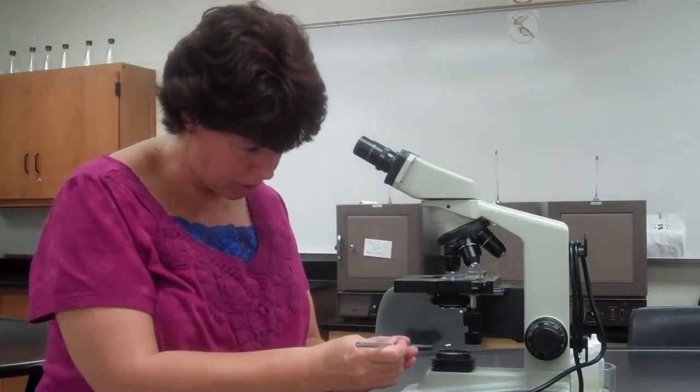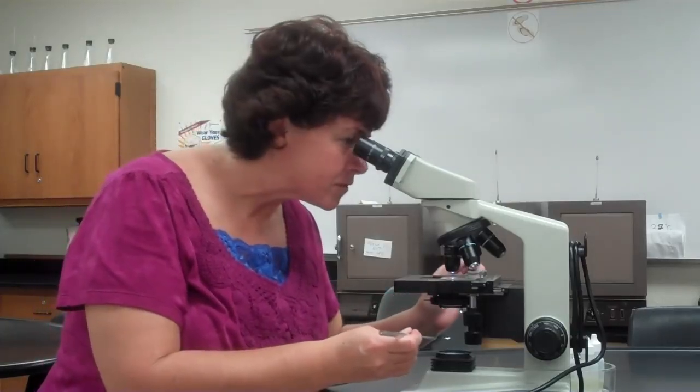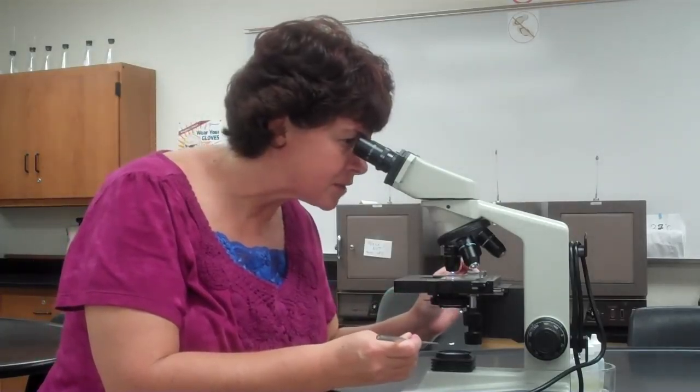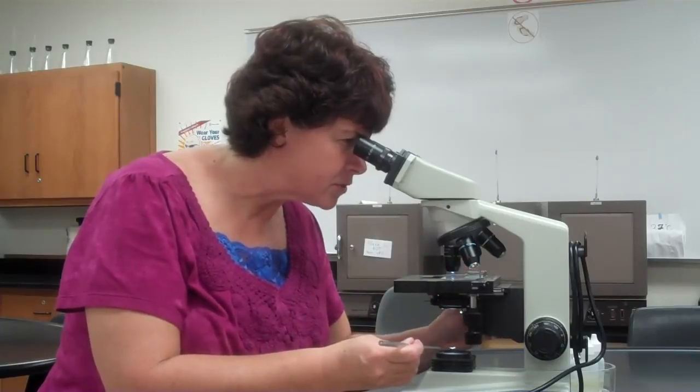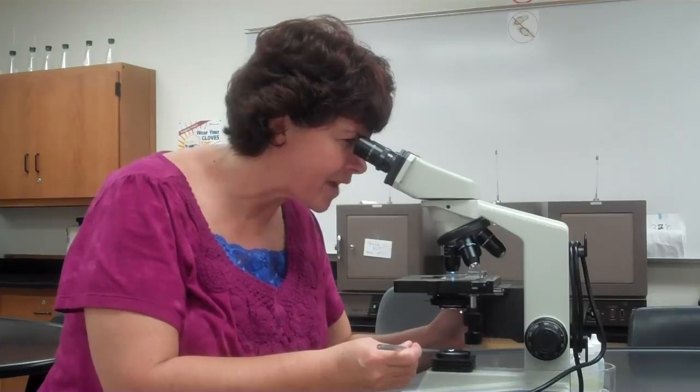So I found it there. Now, to see if your condenser is in the right place, take your loop, hold your loop over the light source, looking through the microscope, try to focus on the loop. It'll be a little bit blurry. So what you can do is you move the condenser until your loop comes into focus. Your specimen will go out of focus. Once that's done, that's exactly the perfect place for your condenser. So if you do that at the beginning of a lab before you do any microscope work, you're going to have better focusing. It's a little trick that I learned. It takes just a minute. If you skip it, you might have issues with focusing.